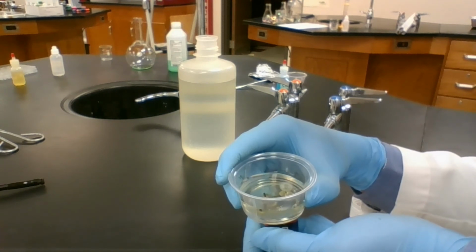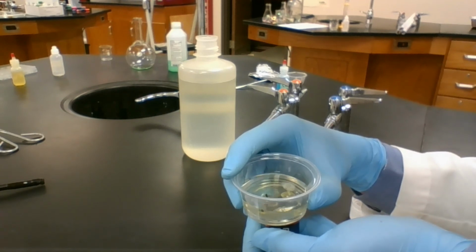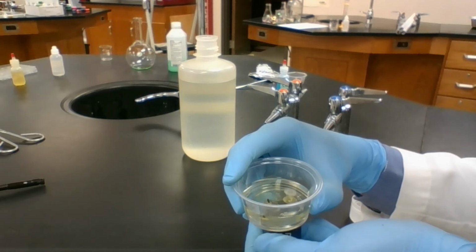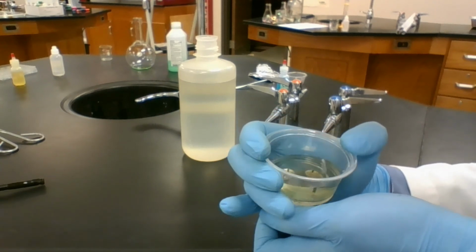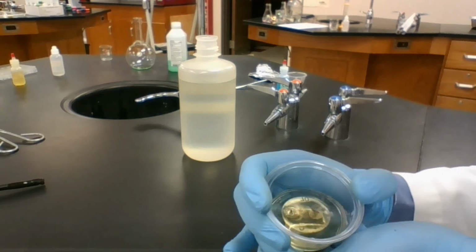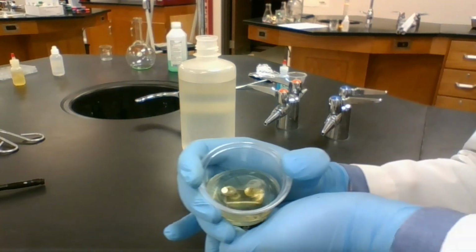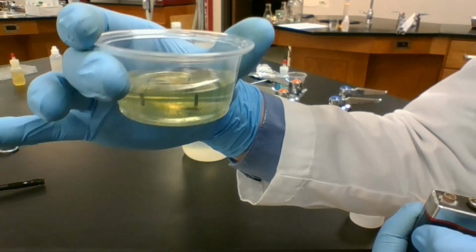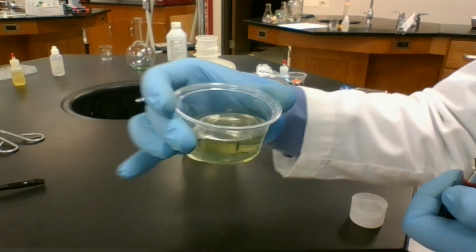Now the other tack on this side is starting to corrode. Flip it again. Yeah, we got a big chunk of corrosion just came off right there. Water is definitely getting a little nasty. So that's a sign that our oxygen is there and it's reacting with the metal in one of those tacks.